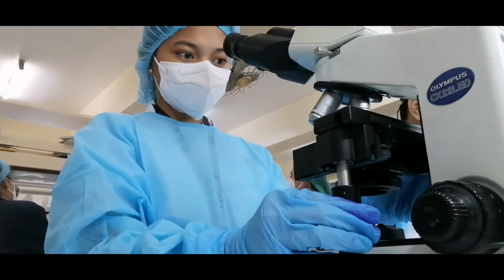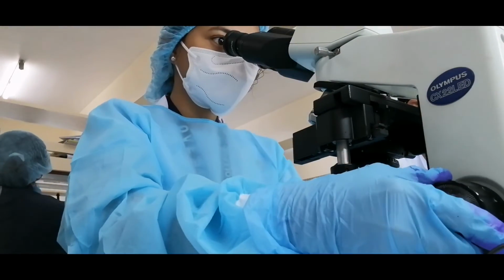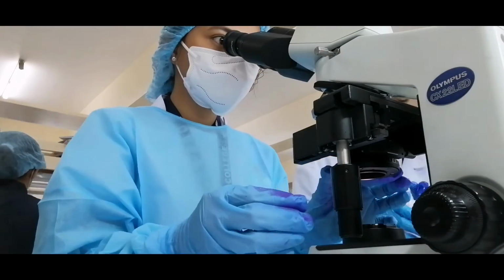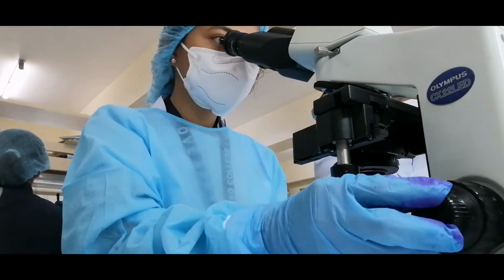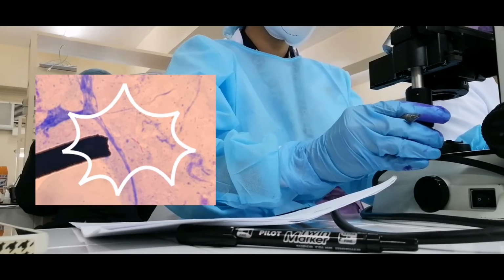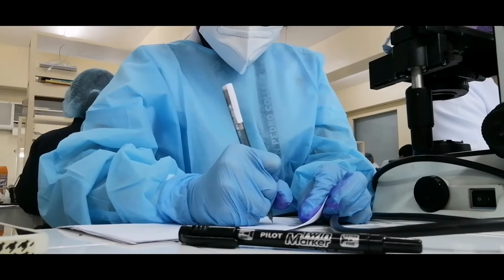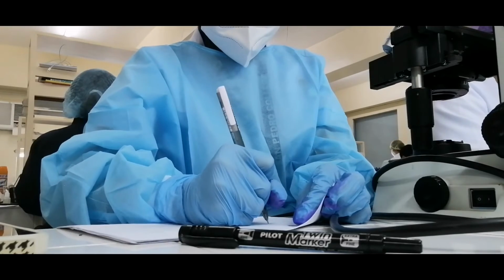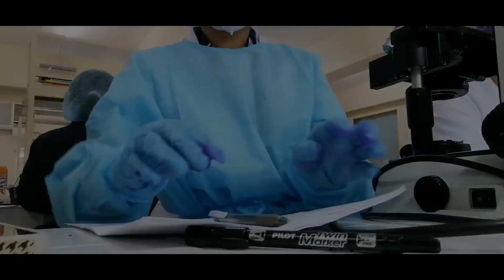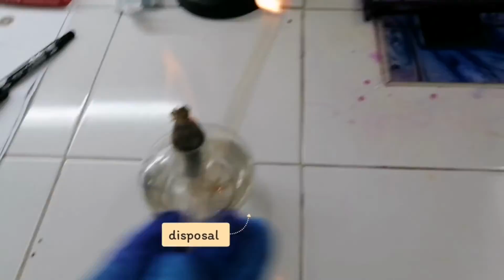After drying, place a drop of immersion oil and examine the slide under OIO. Identify the presence or absence of acid-fast bacilli. Lastly, report the result according to the National Standard Reporting Scale. Burn the used applicator stick before discarding.